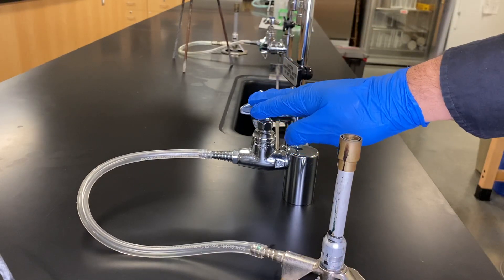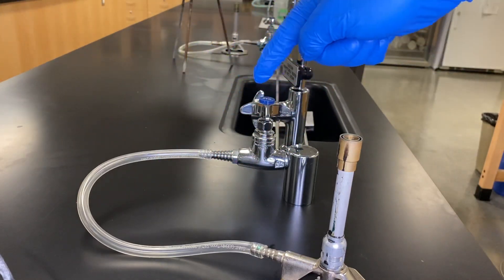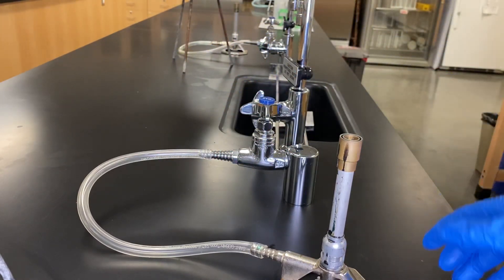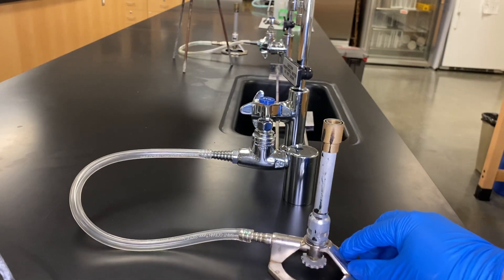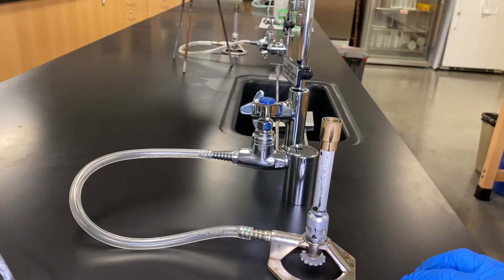Make sure that this guy's always closed, that the tubing is intact, no kinks, no breaks, nothing leaking out, that you don't smell any gas in particular. Making sure that the air vent is adjusted as needed. And that's pretty much simple idea behind this guy. So we'll get to play with this when you come in for your first and second labs.